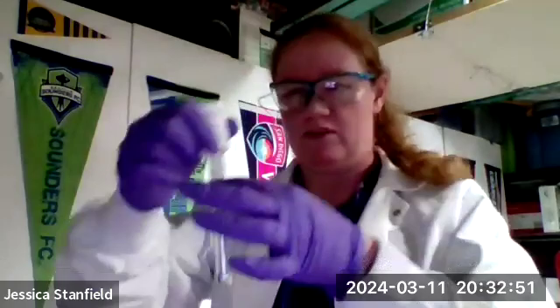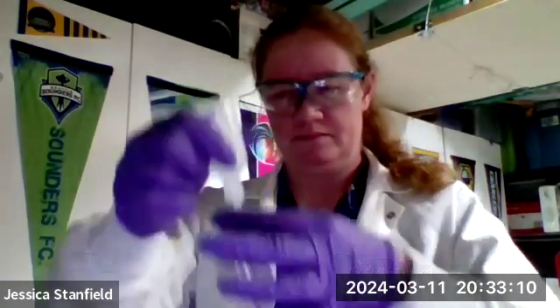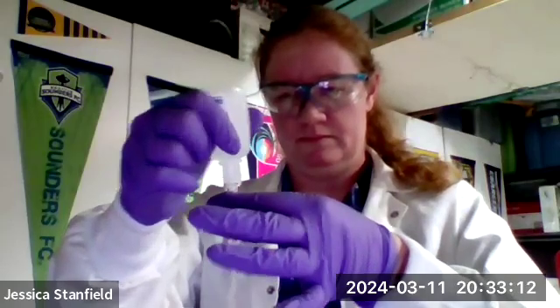Okay, you only need a couple of drops of indicator. So I'm going to add in just a couple of drops here of my indicator. Okay. All right, now it got a little bit cloudy because this is in ethanol, and I did not have that much hydrochloric acid in here, and I put in a few too many drops. So I'm going to add a couple more drops of hydrochloric acid. Normally, when you put it in, you shouldn't see anything forming.